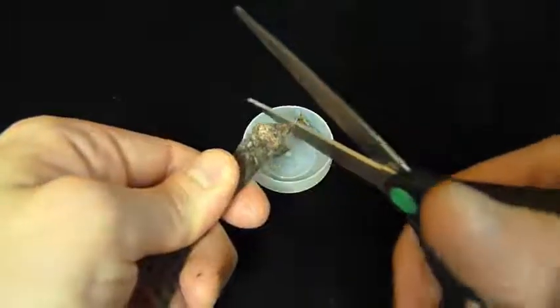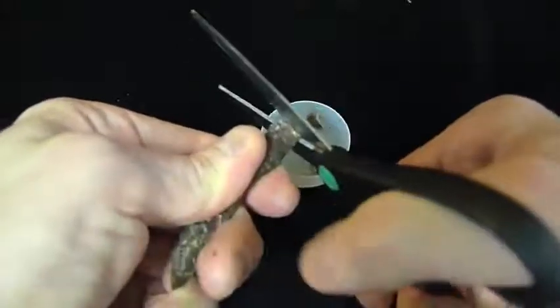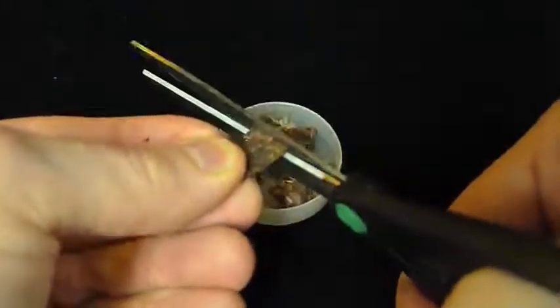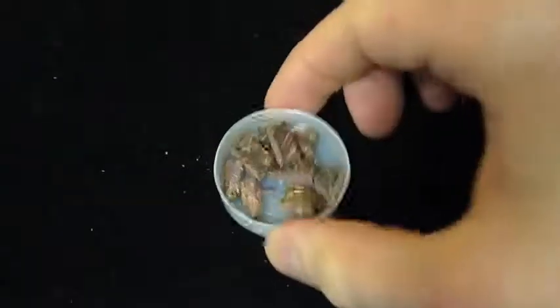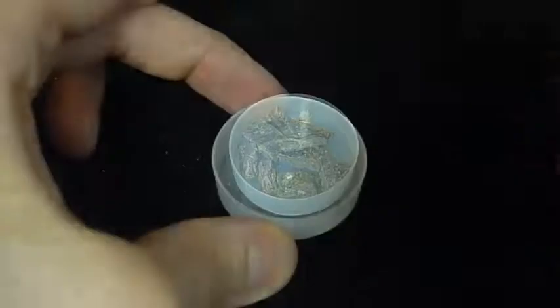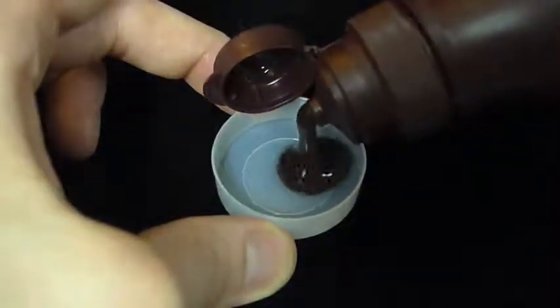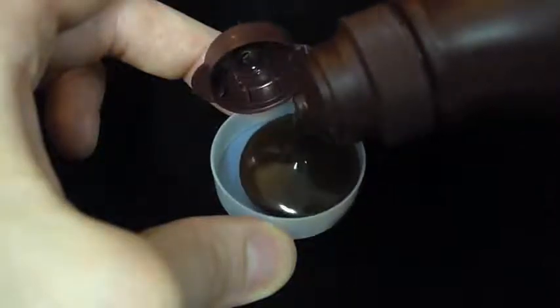When you're preparing something hard like beef jerky, you can snip off several pieces with scissors. I've seen people shred jerky, but that really isn't necessary — about this much will provide a good sample. Syrups and sauces are also easy to prepare. Just make sure that the sample covers the bottom of the sample cup and that the cup is no more than half full.